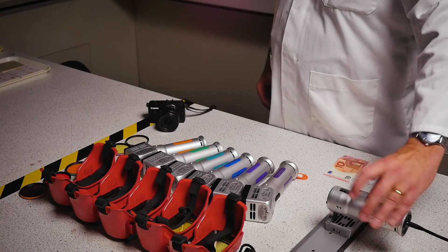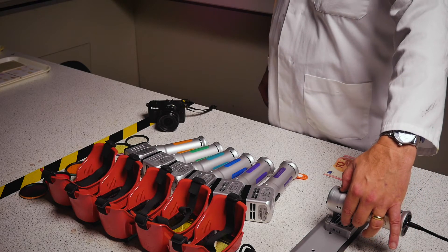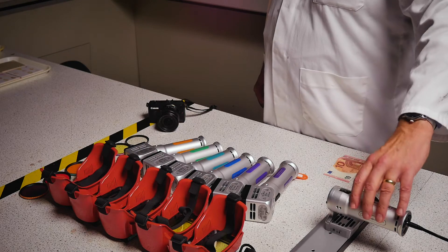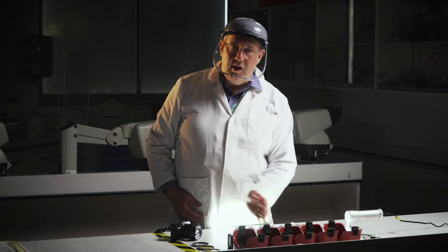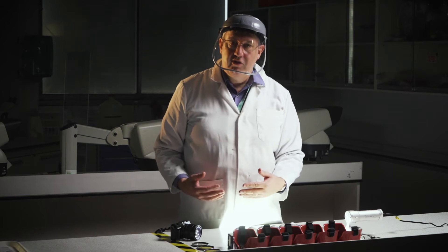And just to activate it, just pressing the switch on the top of the light source and we should see a nice low level light which will pick up things like dust on the floor.